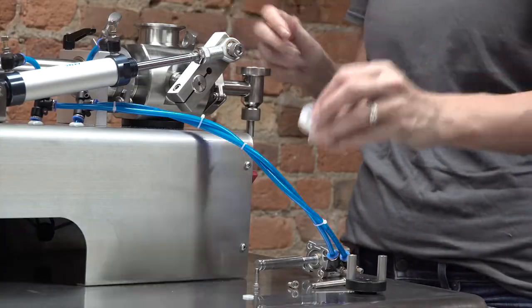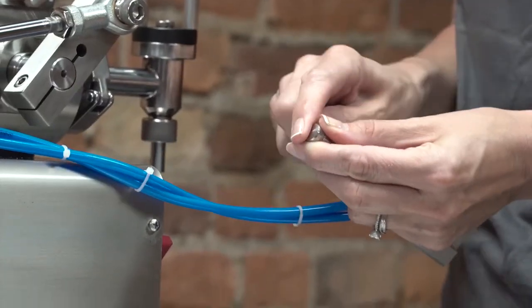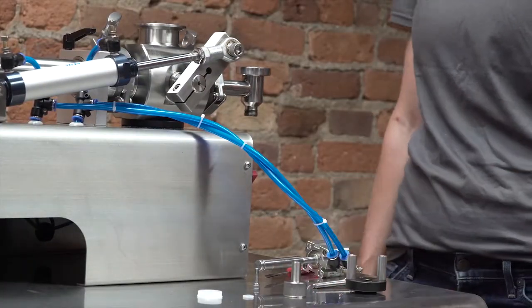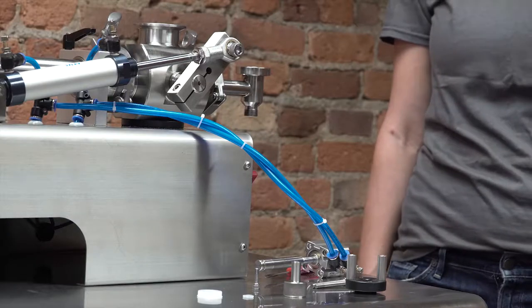Remove the cup seal, remove the o-ring from the nozzle shaft, unscrew the nozzle tip, then use your standard cleaning procedure to clean all components.